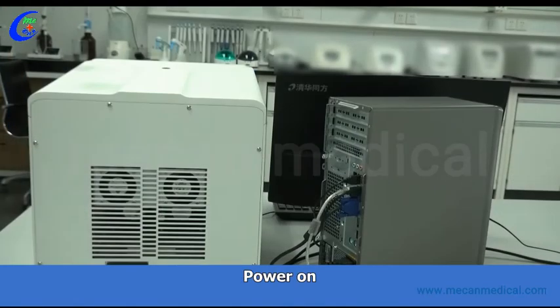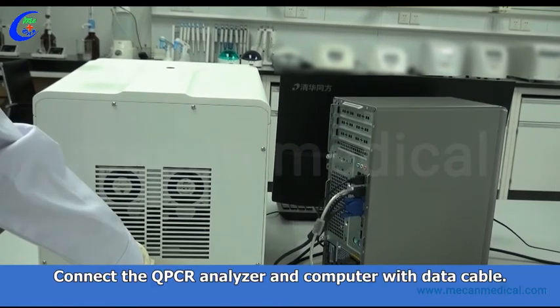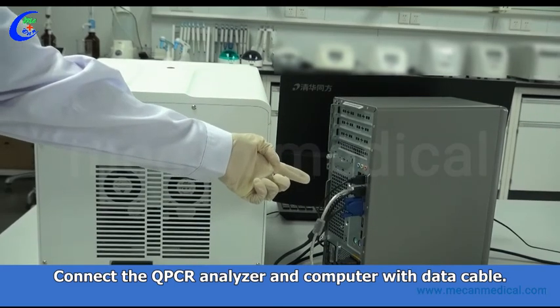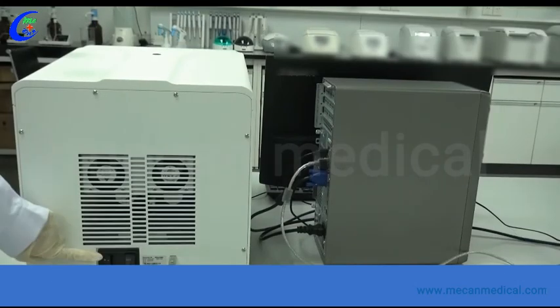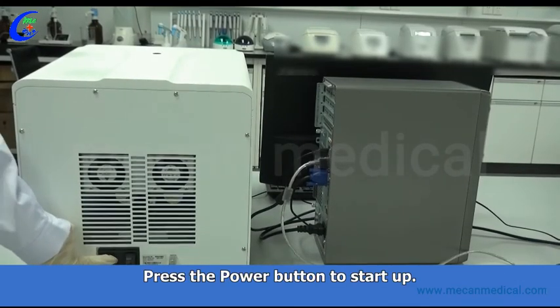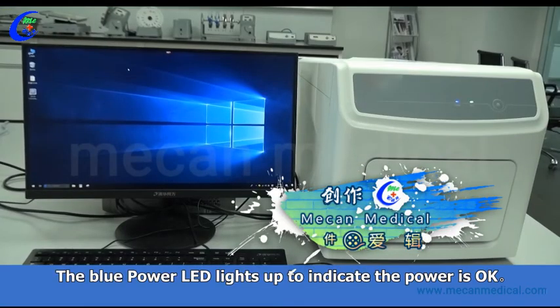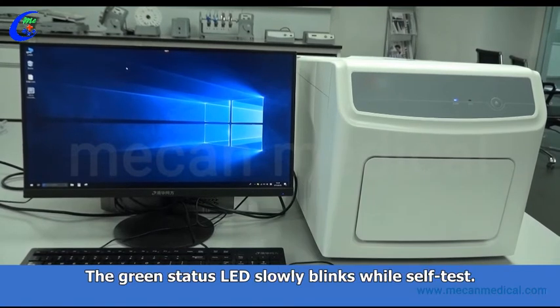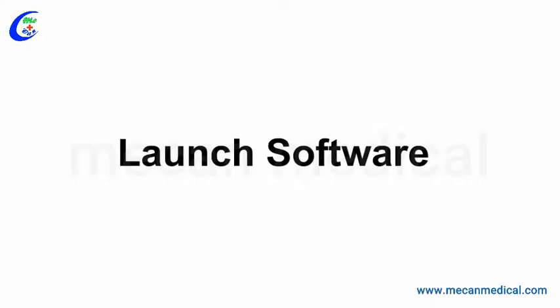Switch the power on. Connect the analyzer and computer with data cable. Press the power button to start up. The blue power LED lights up in case of successful power on. The green status LED slowly blinks while self-test, and it stops blinking when self-test is OK.